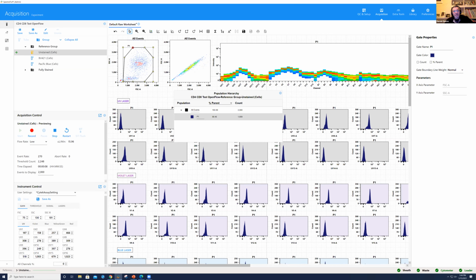Sorry, Kathy, Jim was just asking another question there about do we typically need to change those voltages for most cells because the beads are pushing everything up off scale? So that would be the same for virtually any cell type. Yes, I have never run into a circumstance where I have not had to change that forward scatter gain. So sometimes the side scatter will be close to where it needs to be, but for forward scatter, I would say 100% of the time I've had to reduce it.